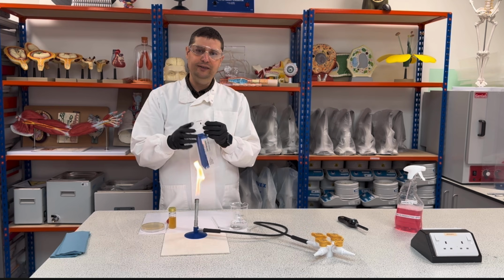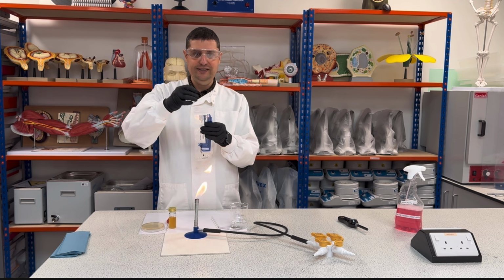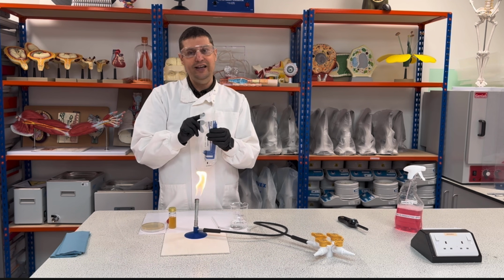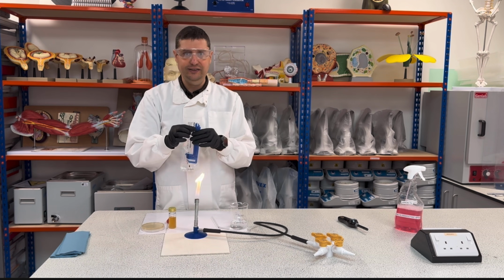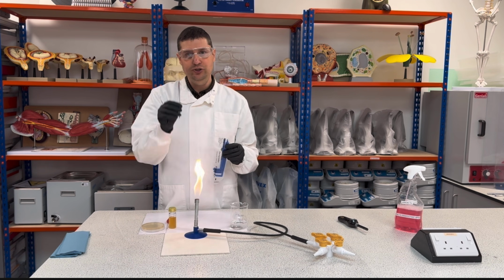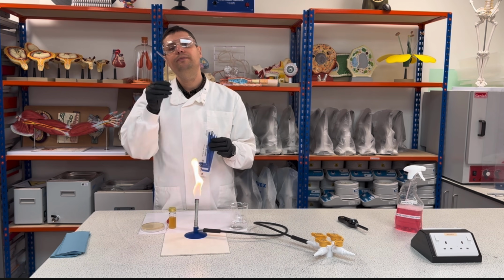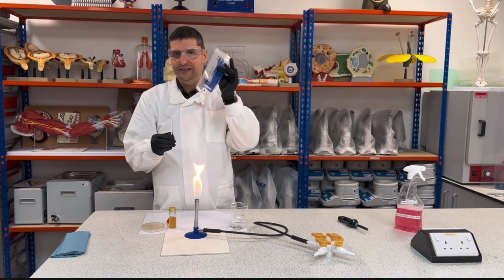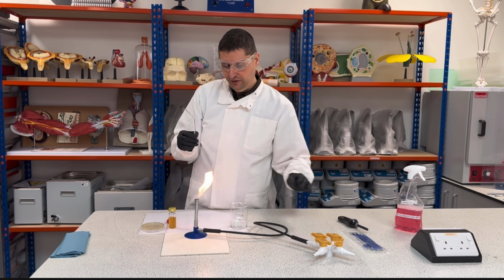When I open this side here, I can remove it, taking the handle from the side, and I can guarantee this will be completely sterile. And after using, I will just dispose of it. So I don't need to worry about disinfecting this. Depending on where you are, you might use this, or you might use those, okay? So I will show you this, that's the more complicated or more tricky part, but the procedure for that is exactly the same. Just open, use, dispose. This one has a little more input, okay?